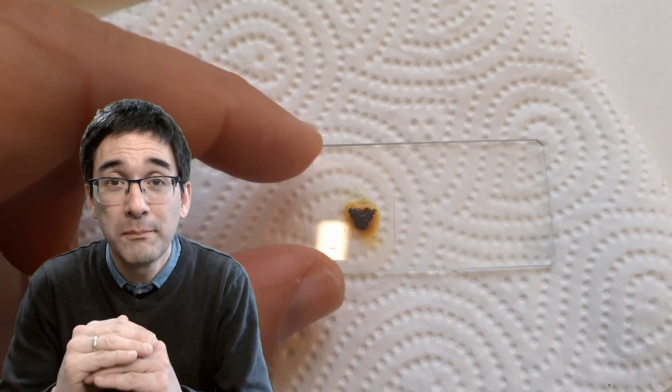If you think it's too dark then dilute it a little bit with water, it's also fine. And then I took some of this specimen here, a little bit of the banana material stained with the iodine, and then I placed the cover glass on top. And then I really pressed very hard to make sure that the banana is very thin and spread out.